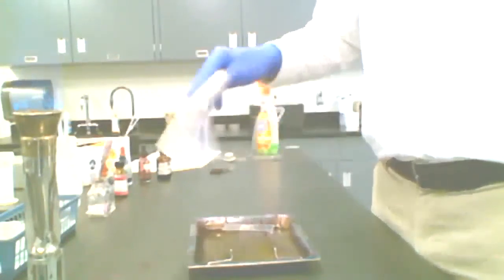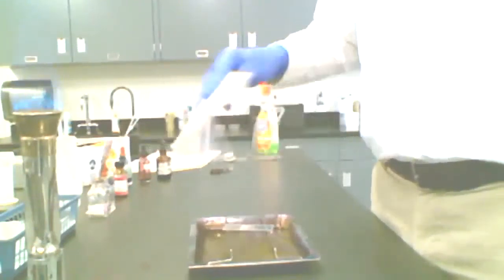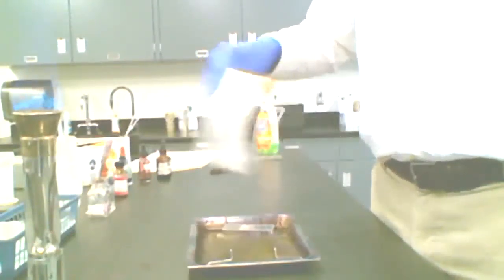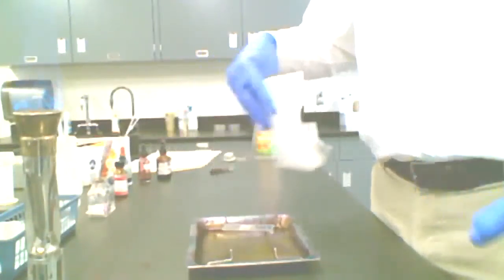This one's actually pretty thick, and when you're starting out, it's often acceptable to err on the side of a little more organism than you would normally use. The problem with really thick smears is that when you stain that, the individual cells are so densely packed, they're laying right on top of one another, and it's really challenging to see the cell shape or morphology, and also how the cells are arranged relative to one another.